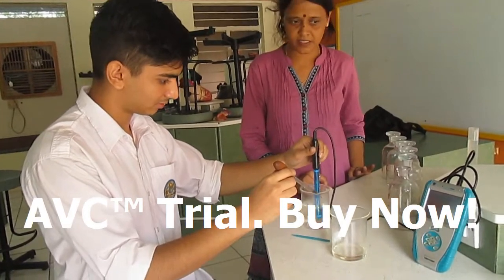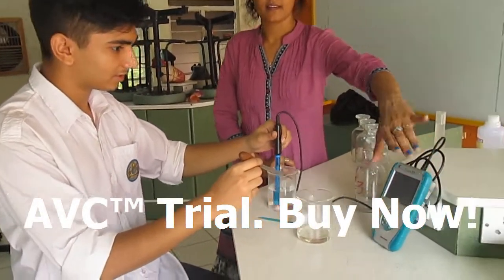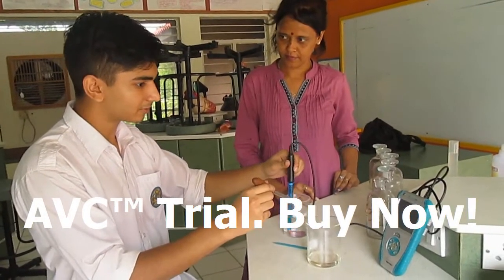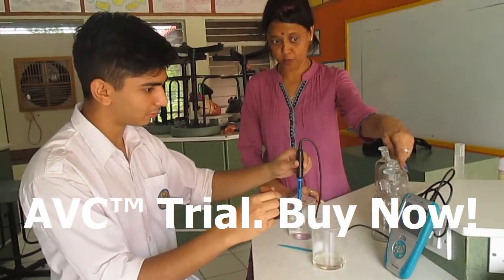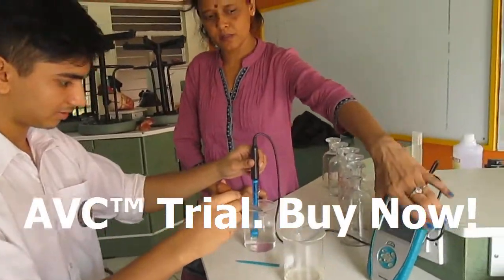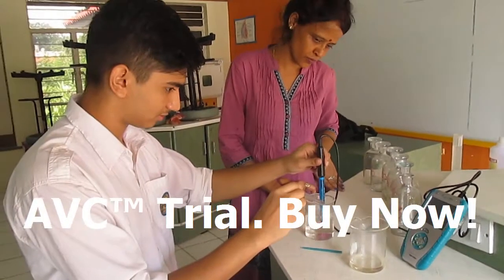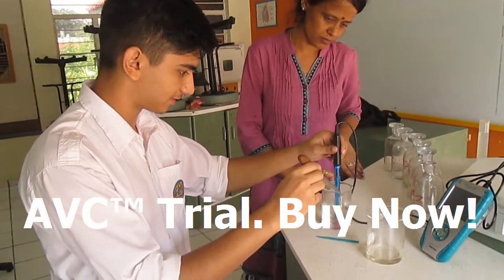In our school we use ICT because the data can be easily recorded into a computer by connecting the pH probe. This can form an interface between the probe and the computer, so the data can be easily transferred to the computer and a graph can be generated.